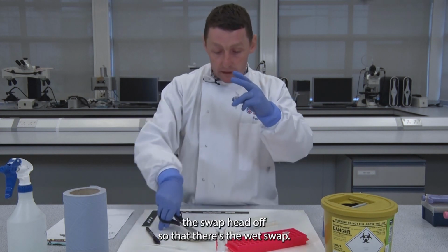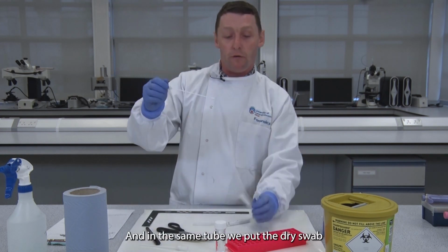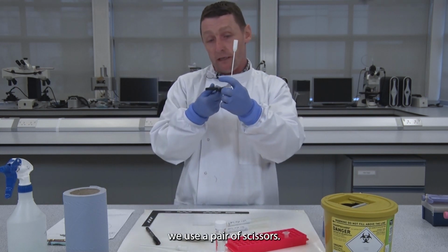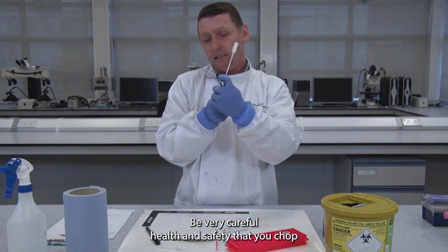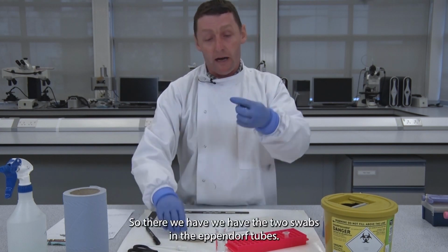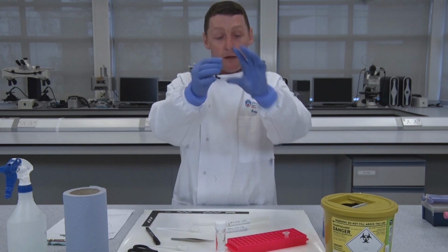So there's the wet swab, and in the same tube we put the dry swab in there, and exactly the same process. We use a pair of scissors, be very careful, health and safety, that you chop the plastic off. So there we have the two swabs in the Eppendorf tubes.